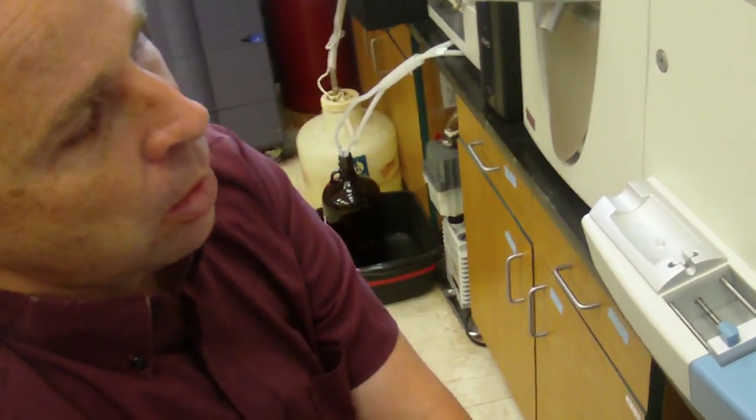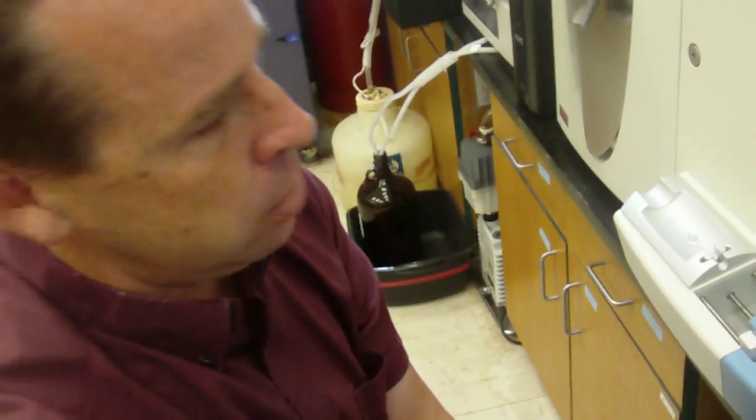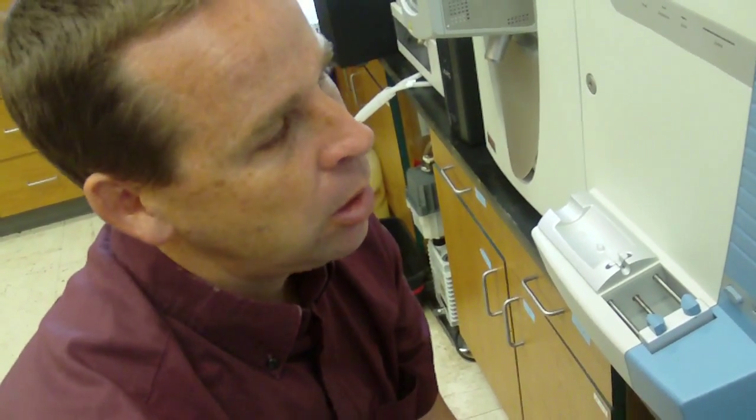All right. So here we'll see the Mascot results in just a minute. It's going to give us a list of proteins, all right? A list of proteins whose peptide fragments were found. Associated with these proteins are generally going to be a score of some kind. Sometimes the scores are high, sometimes they're low. The higher the score, the more fragments it found from that specific protein. It's kind of hard for us, when we fragment the data, to know the reliability of the scores. But here it found 13 proteins in our first sample, in our first cut.